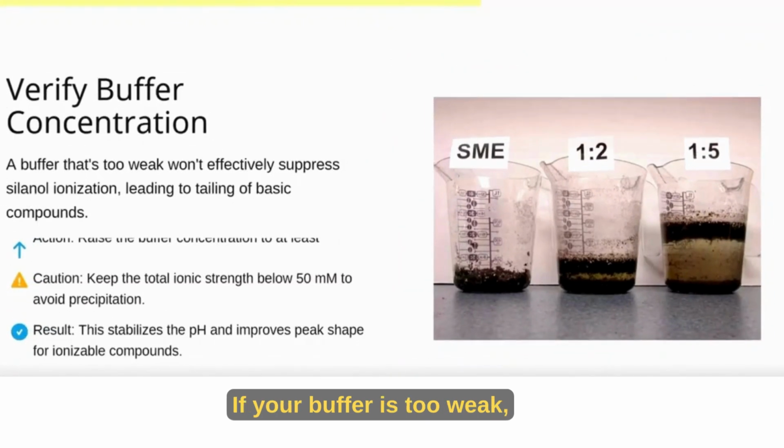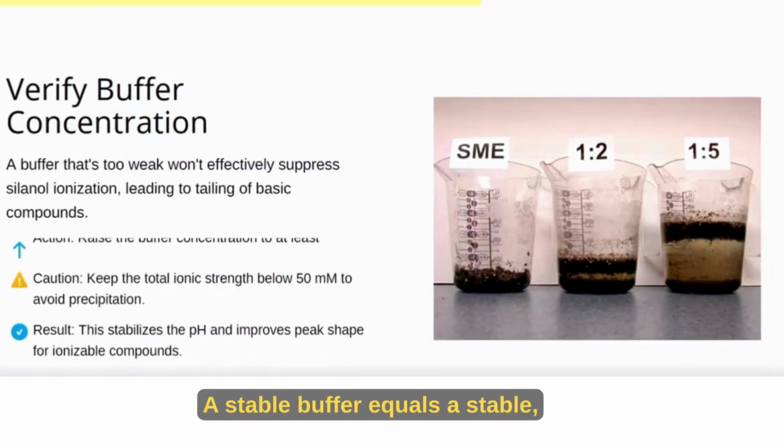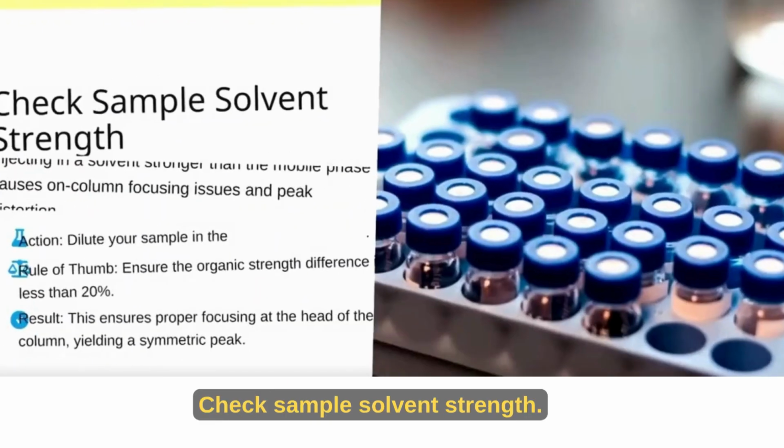Verify buffer concentration. If your buffer is too weak, your pH control disappears, and peaks start to tail. Increase buffer strength to around 10 millimolar while keeping ionic strength below 50 millimolar. A stable buffer equals a stable, symmetrical peak.